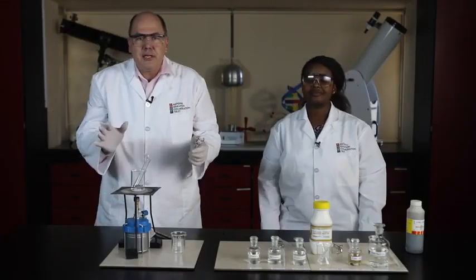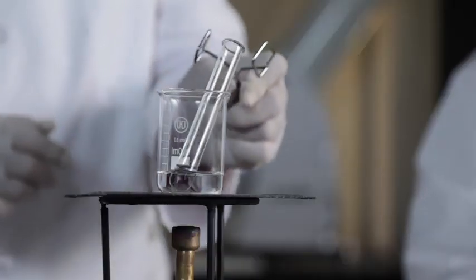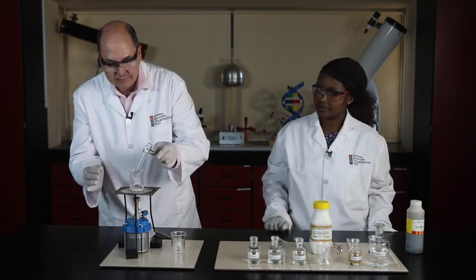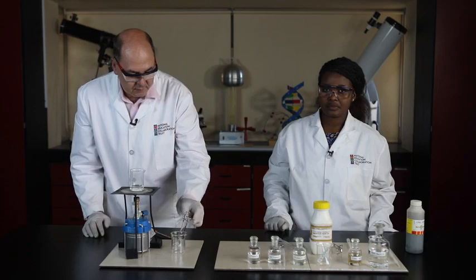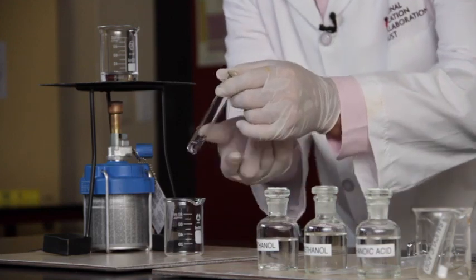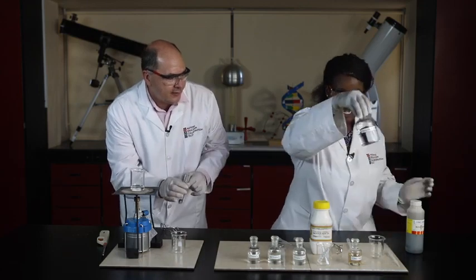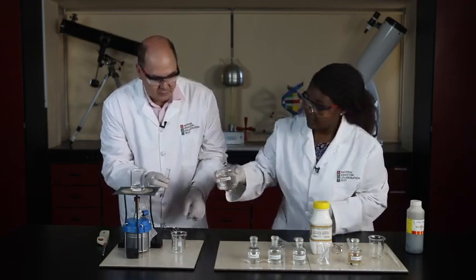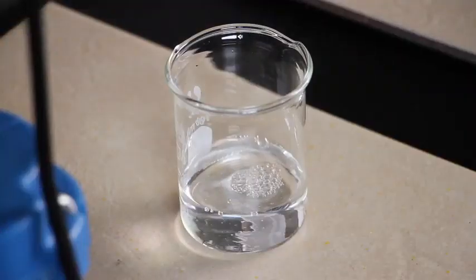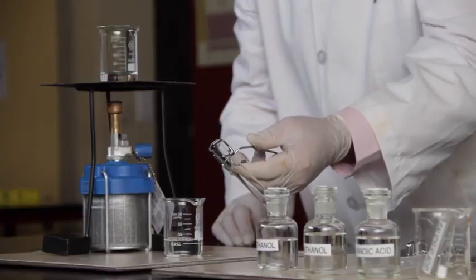Okay, it's been about a minute that the reaction mixture's been in the hot water. We're going to take it out and put it in an empty beaker and allow it to cool for a little while. Right, let's check. This reaction mixture has cooled down nicely. So let's get ready. Let's add dilute sodium carbonate in here. And now I'm going to pour in the reaction mixture.